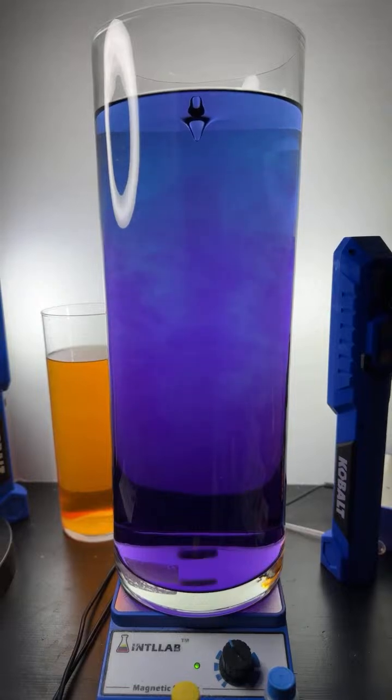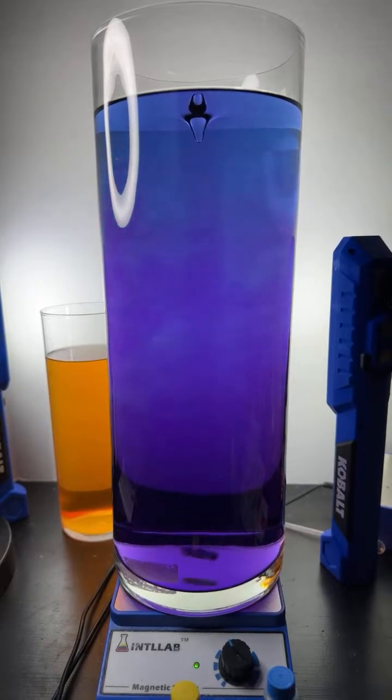That's really nice. All right, let's add a little bit more acid here. Where colors are kind of falling behind there a bit.